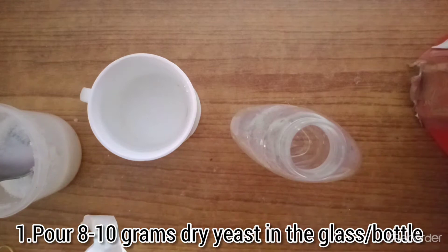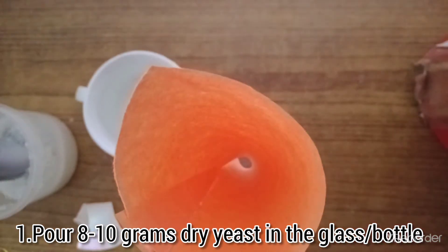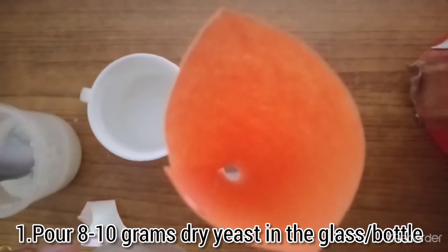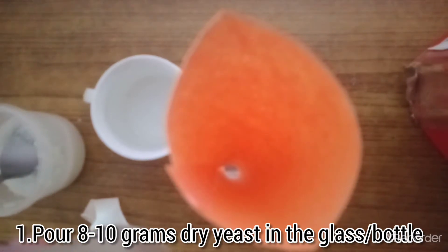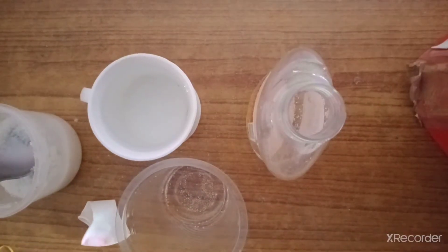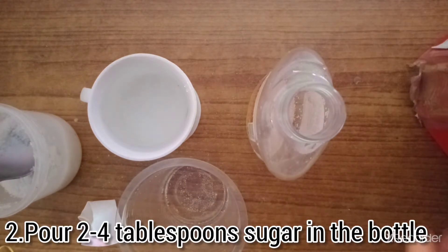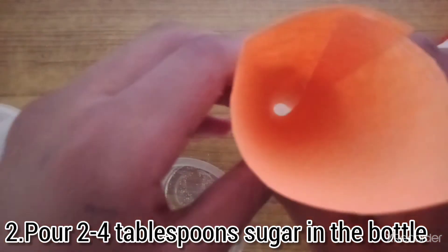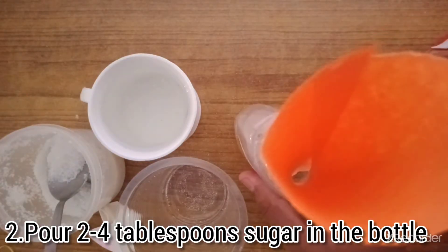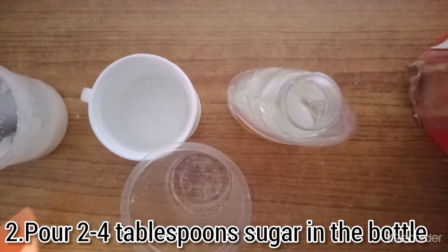The first step is to put the dry ingredients in the bottle using a funnel. First, I will pour the yeast. I have poured the yeast. Now I will pour the sugar using the funnel — the quantity of sugar should be two to four tablespoons. We have also poured the sugar in.